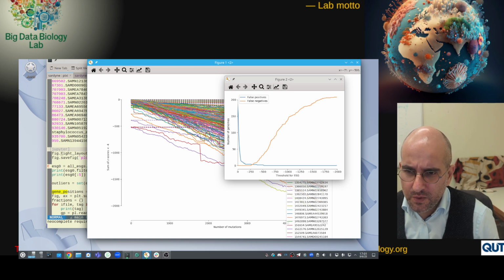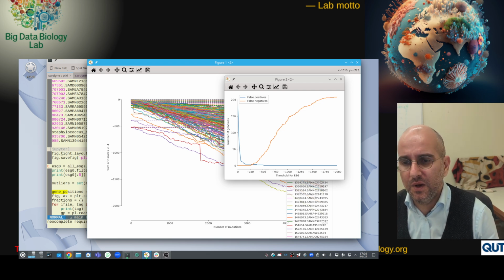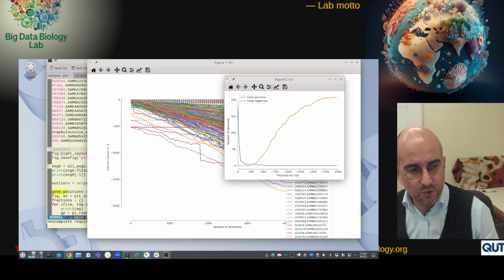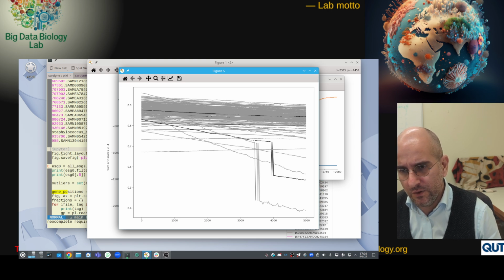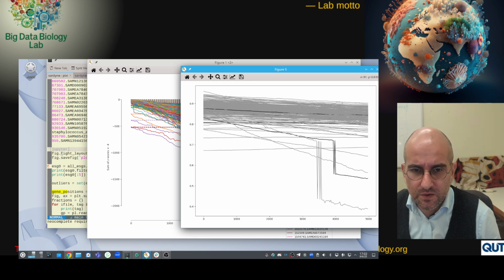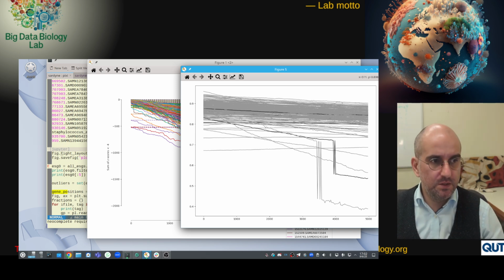But what we've been trying to do the last couple of weeks is identify properties of these genomes that would allow us to say, okay, these are weird. The first thing I thought about was gene density, coding density. Maybe they're very optimized genomes. So I'm going to plot the coding density as a function of the number of mutations, with the same x-axis. This is the number of mutations, and this is the coding density from 0 to 1. The darker, black lines are the outliers. I expected the outliers to start up here, since they have a lot of small genes, the theory being that maybe they would be very optimized. And no, if anything, they're on the lower end, but still they're not clear outliers. You have to explore these things.